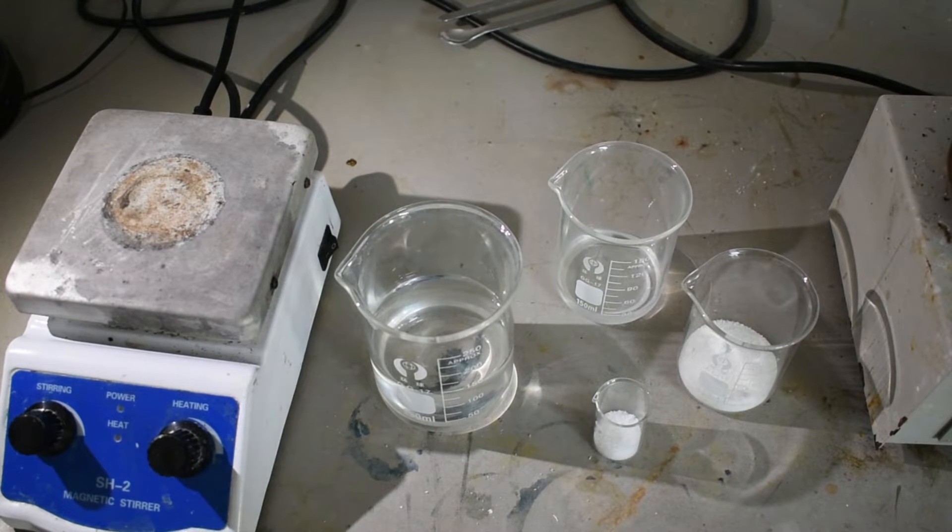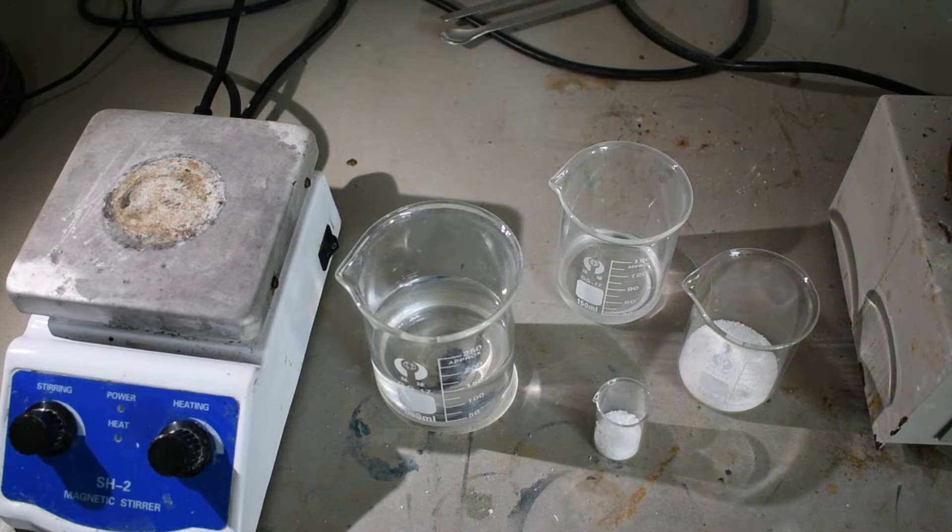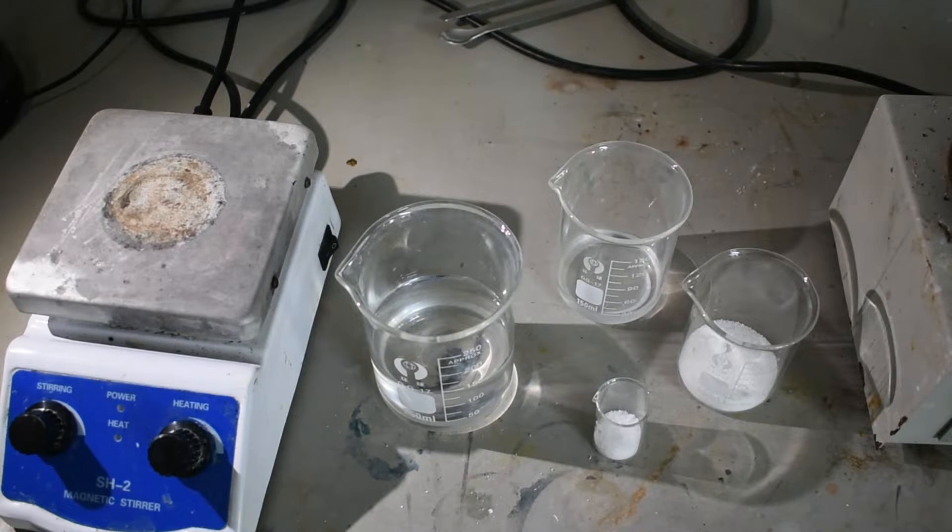Hey guys, welcome back to another video. Today I'm just going to be doing a short inorganic preparation of sodium perborate.